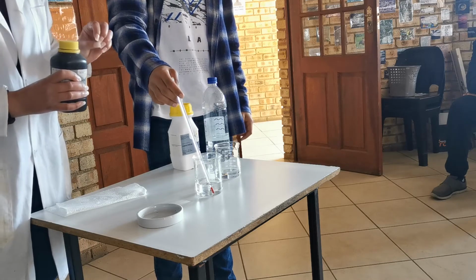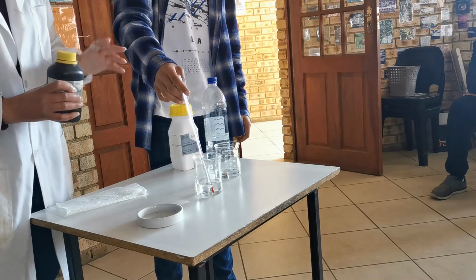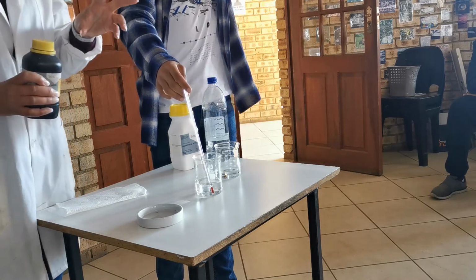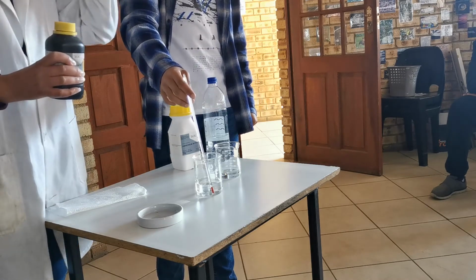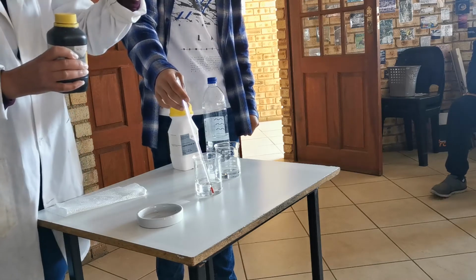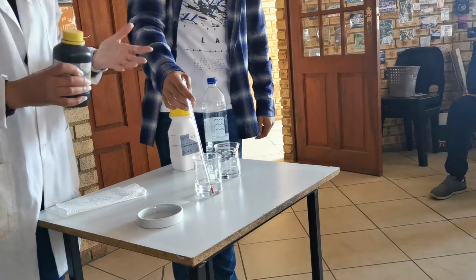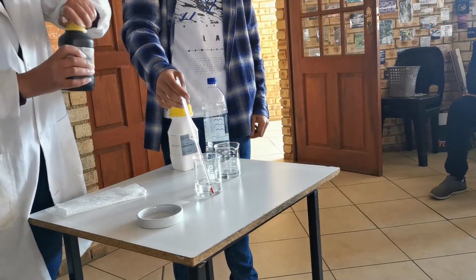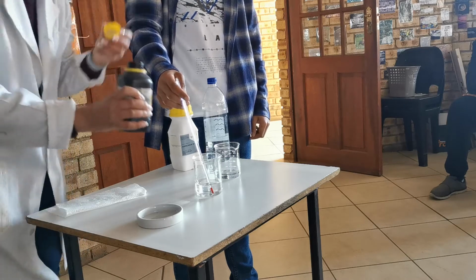I know you're thinking, yay, let's see what happens. But what happens is the acid actually spits. Because the reaction is so violent, the acid actually shoots up at you, which is really, really dangerous, which is why eye care is so important. Safety first. Ready?